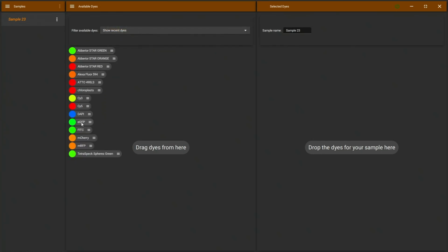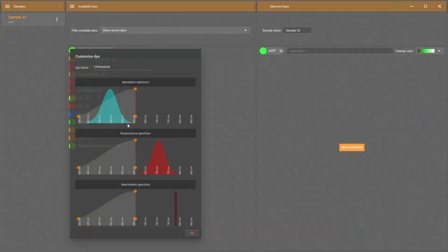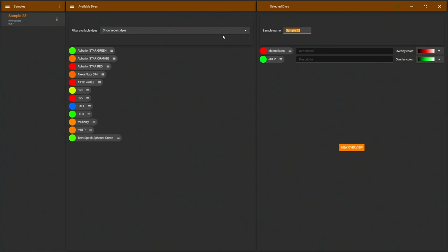There I have EGFP for our EGFP tubulin. And we also have autofluorescence, here the chloroplast. How did I make these? Here you see a customization menu, which I can do for any dye. I can adjust the spectral range of absorption and fluorescence here and set up basically a new autofluorescent dye. I can also do this for carotene or any other dye.